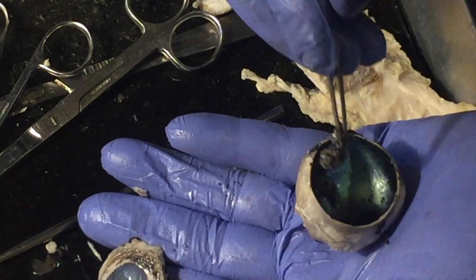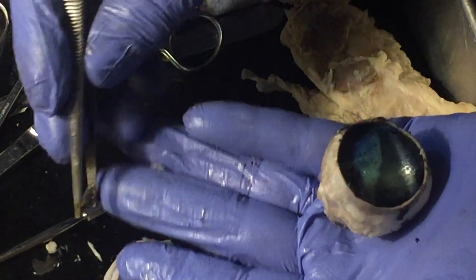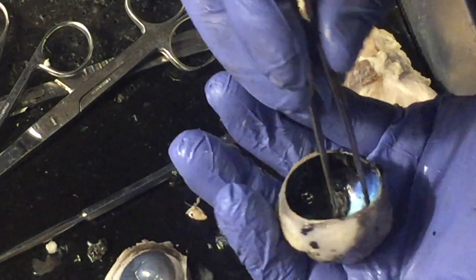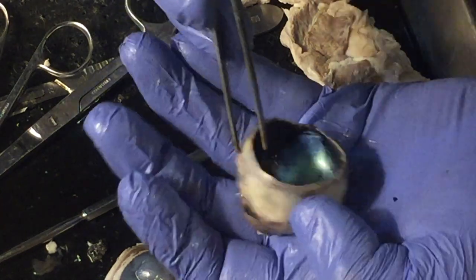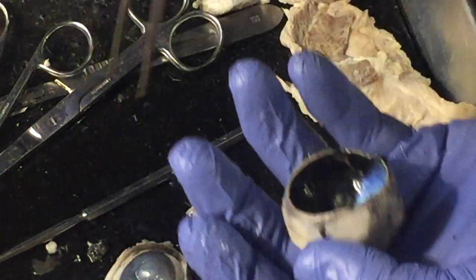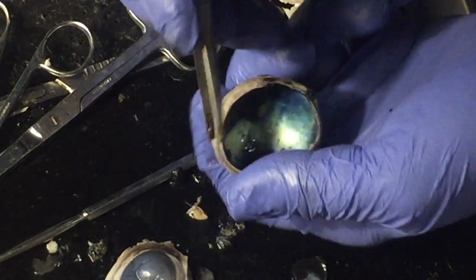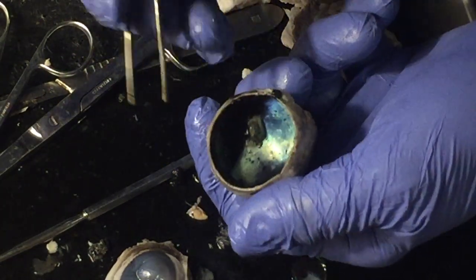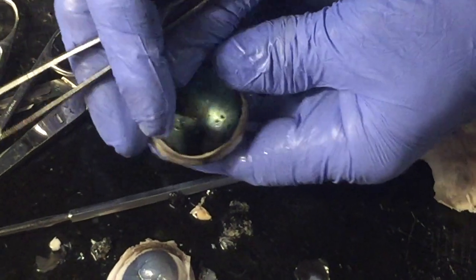Retina, I'll pull it right off now. Retina, choroid, maybe we can see it even a little bit better there. There's a retina. The choroid is the middlemost, and the sclera is the outermost that forms the white of the eye. In cattle and many animals, they have an additional layer called the tapetum lucidum, and I can separate that out. It's what makes that pearly luster look in there.